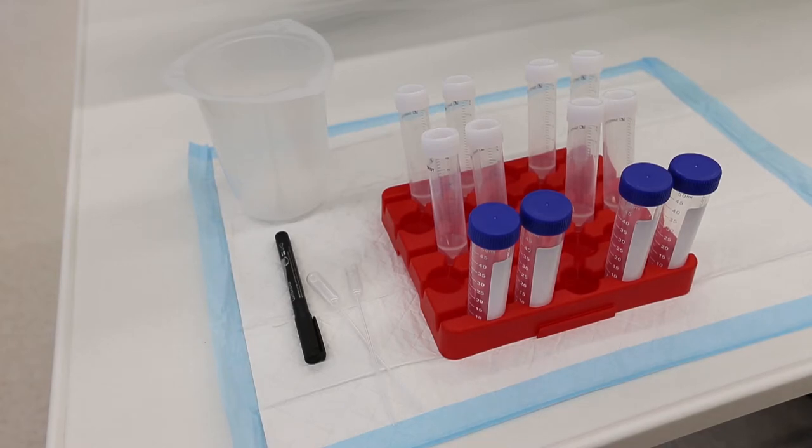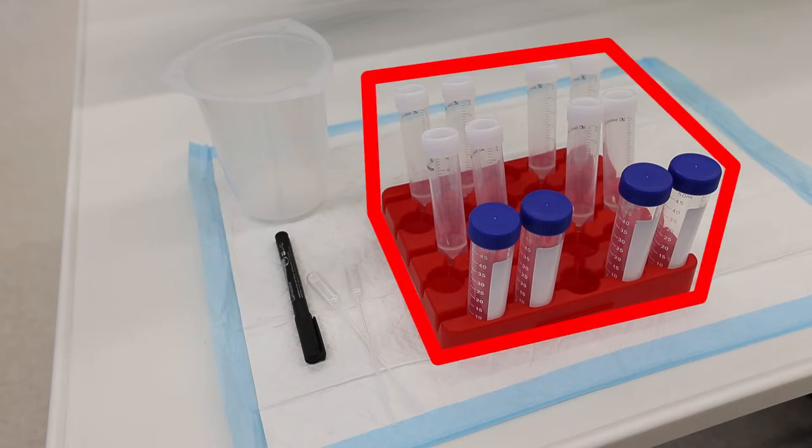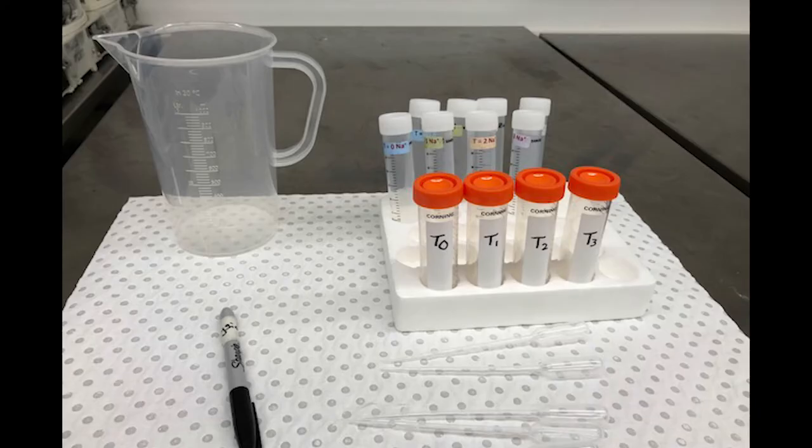To do this, collect a set of 12 tubes as shown here. You will then need to label your tubes so you do not get them mixed up during the class. The white top 30 ml tubes will already have a sticker showing the time point and the ion being tested stuck to the tube, so all you will need to do is add your initials to these tubes.